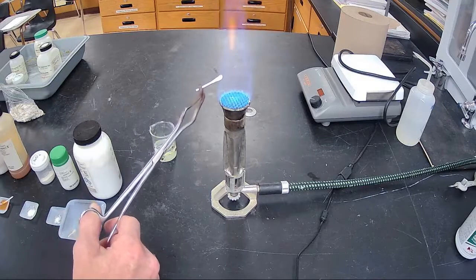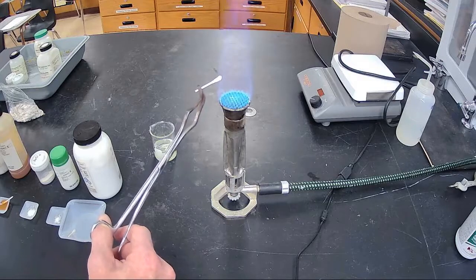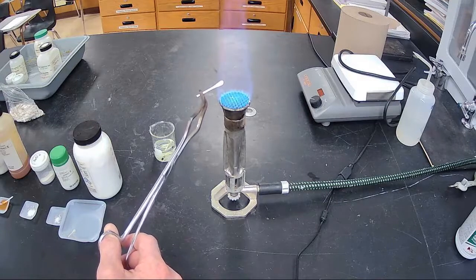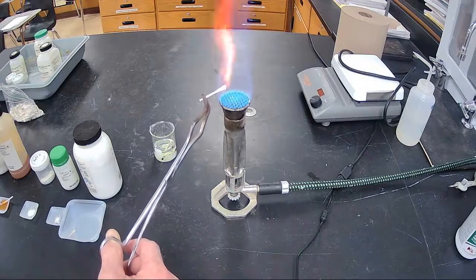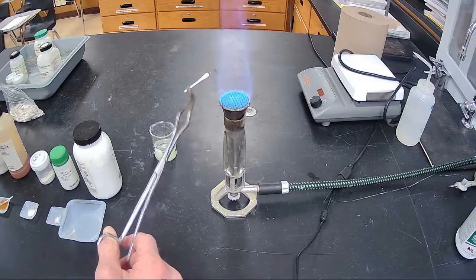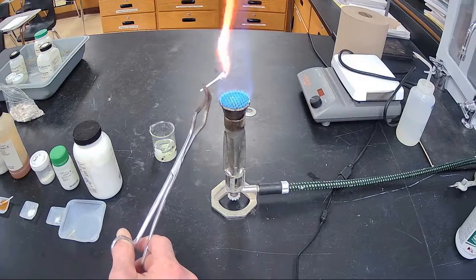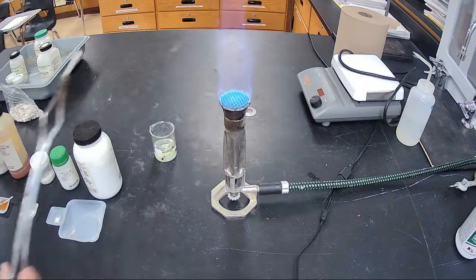Salt number 1 takes a little while to get going. It has to react a little bit, but once it gets going, you'll be able to see a characteristic color here. Here it goes. It's starting to react a little bit. There we go. It's producing a pretty good color now. You should see this one, characteristic color. I don't know how well that's showing up on the screen, but this should be an orange color for salt number 1, if it's coming up there pretty well.